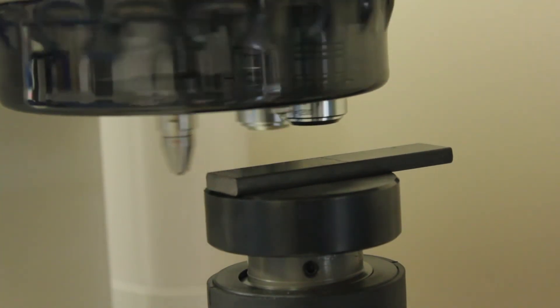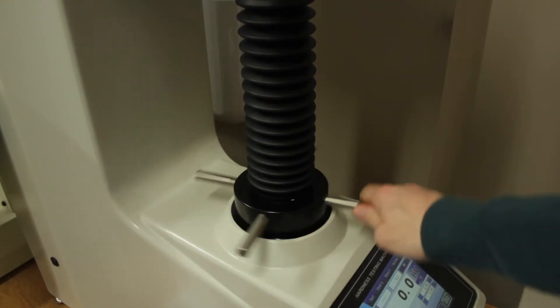Re-index to a magnifying lens and whilst looking through the viewfinder, adjust the table so that one of the sample indentations comes into focus.